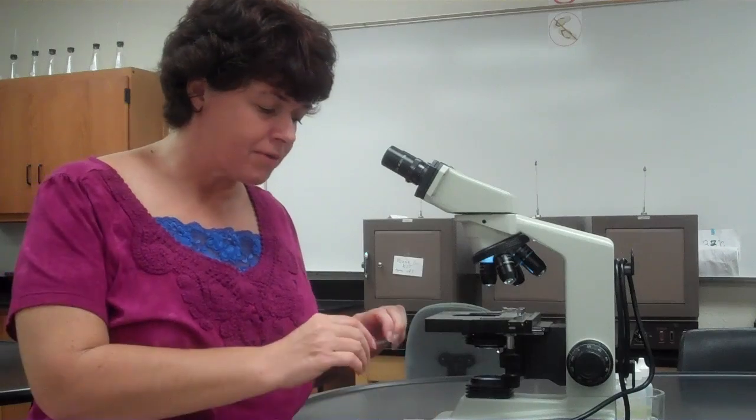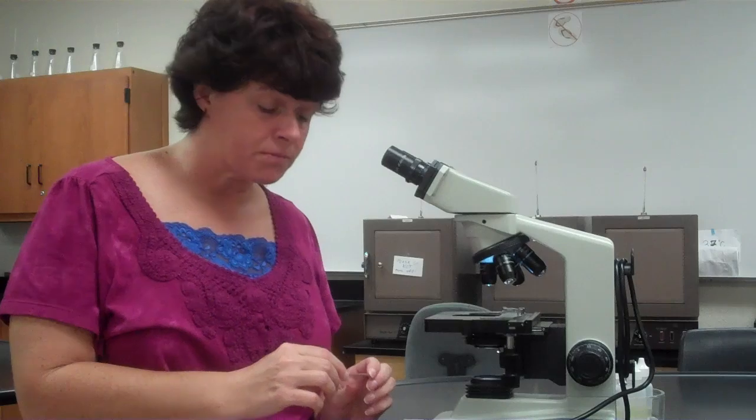Now, as we get started, let's think a little bit back about what we've done. So we've made some stains, and remember that I had you draw circles to where you're going to put your stain, where you're going to put your smear. That was to make sure that when you look under the microscope, you're looking in the right place. When you look at this, you may feel like there's nothing on the slide, looking at it with the naked eye. Remember, bacteria are so small, you may not see your smear with the naked eye. So drawing that circle was so that at least when you put it on the microscope, you have somewhere to shoot for.